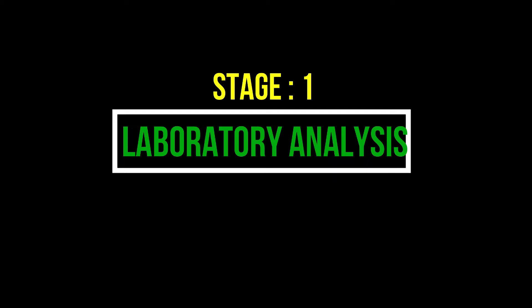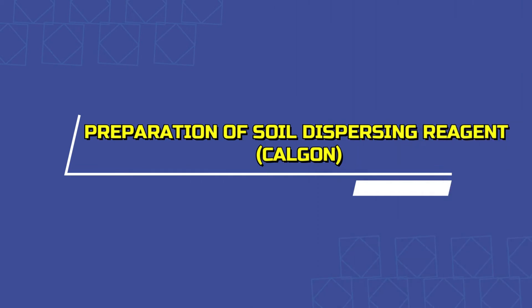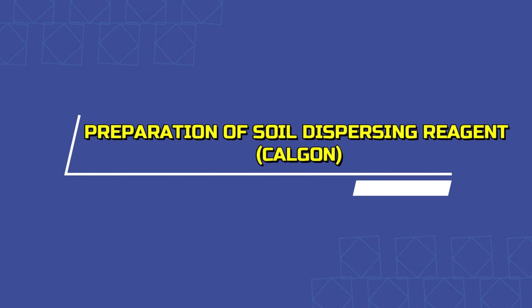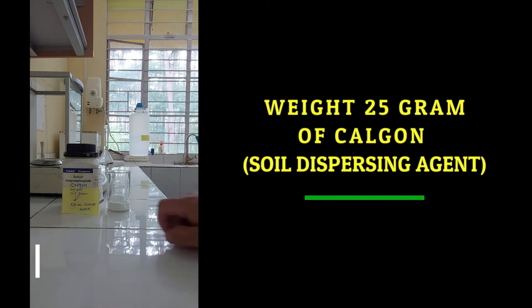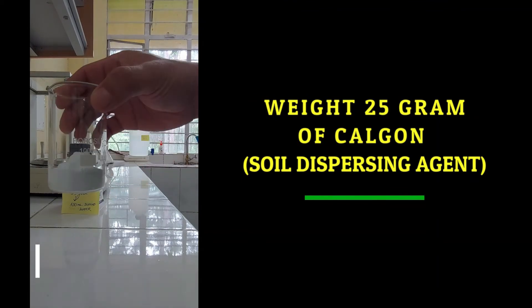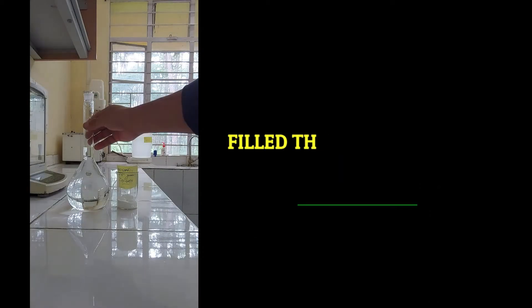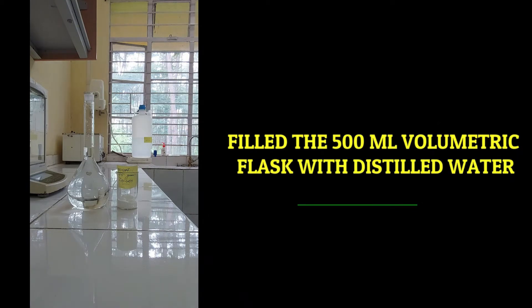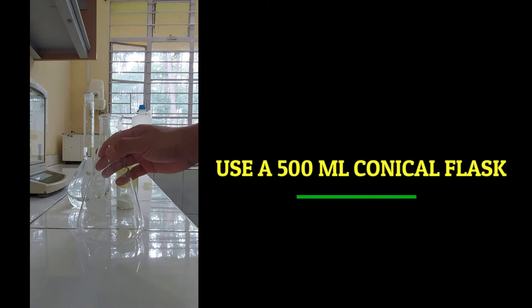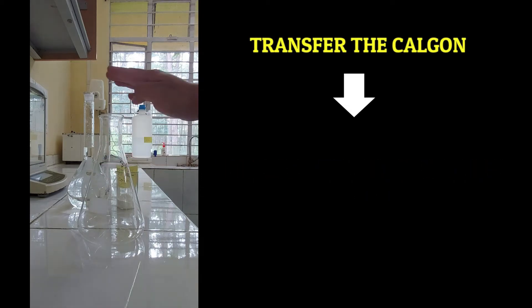Now let's do the laboratory analysis for determining the percentage of sand, silt, and clay using the hydrometer method. First, we need to prepare the soil dispersing reagent called Calgon. To prepare Calgon, first weigh 25 grams of Calgon in a 100 ml beaker, fill the 500 ml volumetric flask with distilled water, then transfer the Calgon into the conical flask.